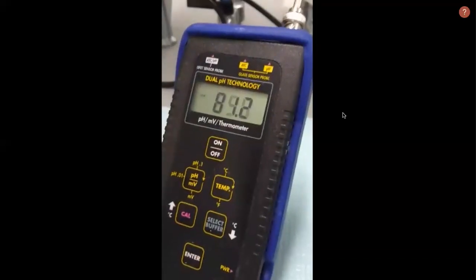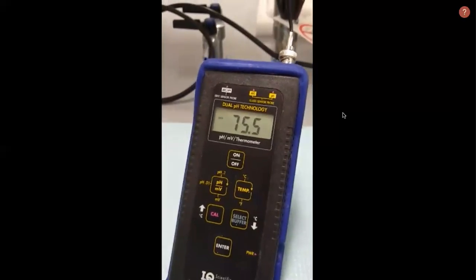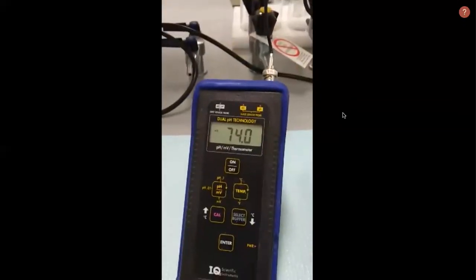Wait until the reading on the probe settles, record that value, and then add the next spike. Repeat for a total of 4 times, recording after each spike.